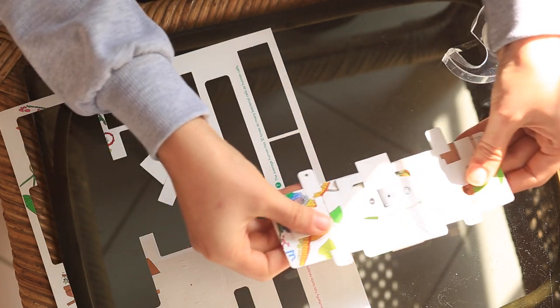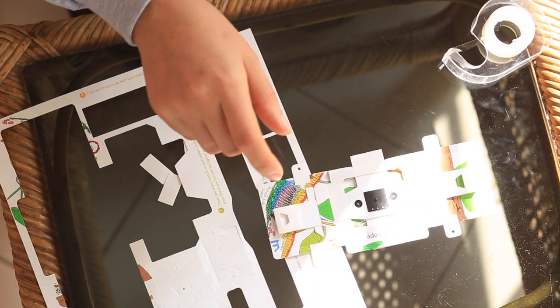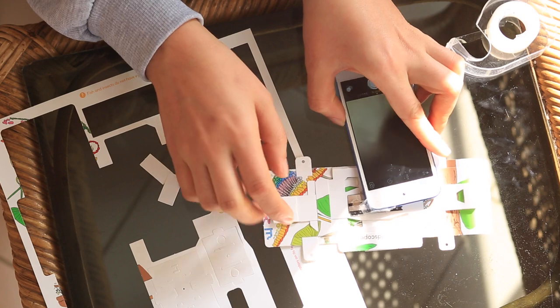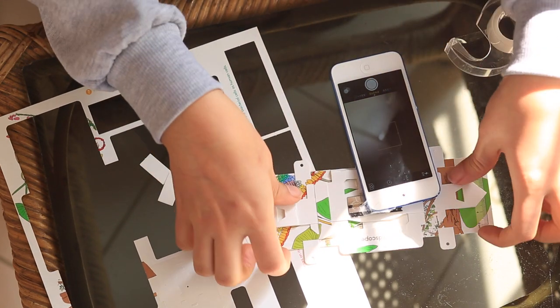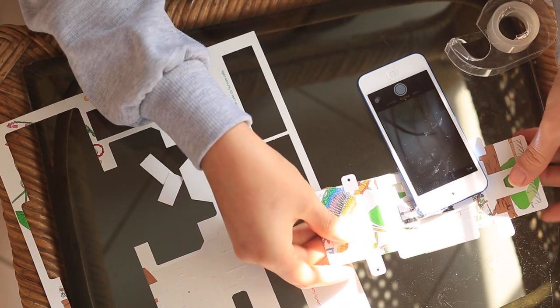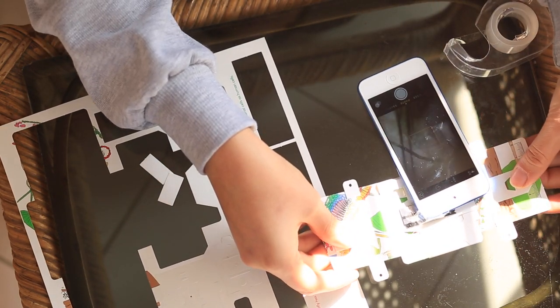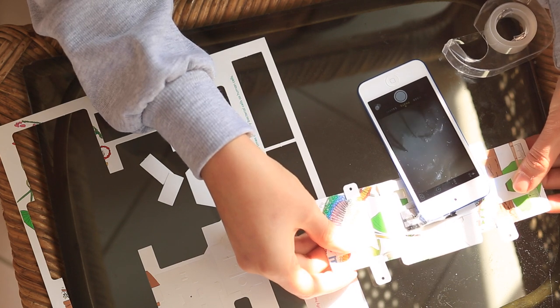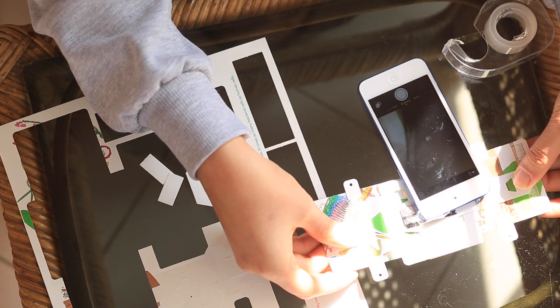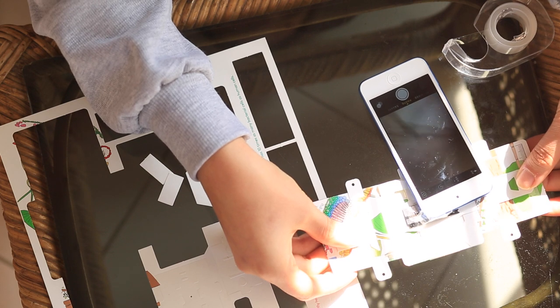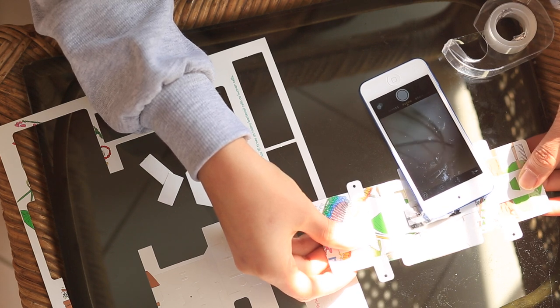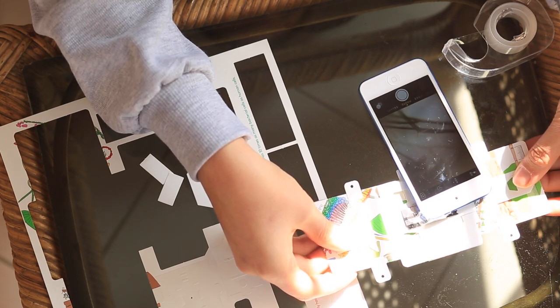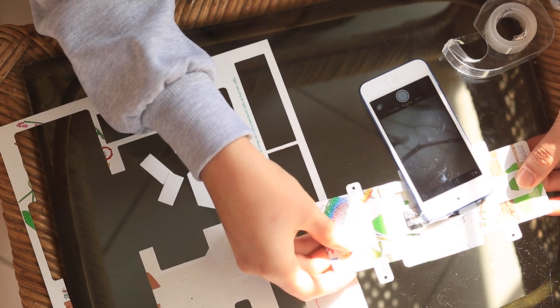Then you can image whatever you just saw. So you have your phone again. You can look at, this is I guess a mosquito. I think it's a mosquito. So there's the wing of the mosquito. The other wing. There is its leg. Antenna.